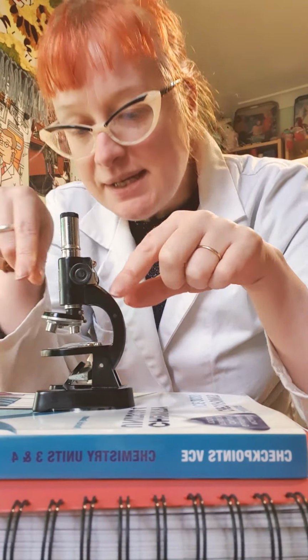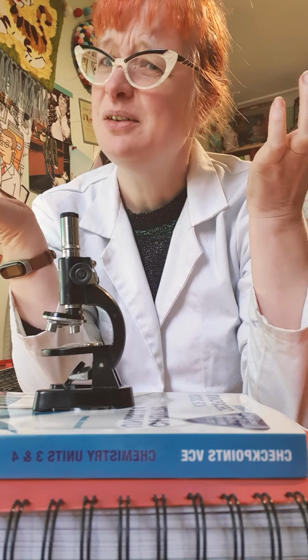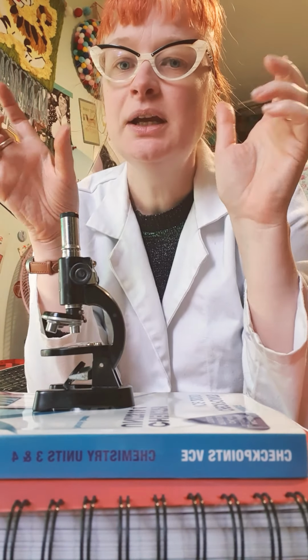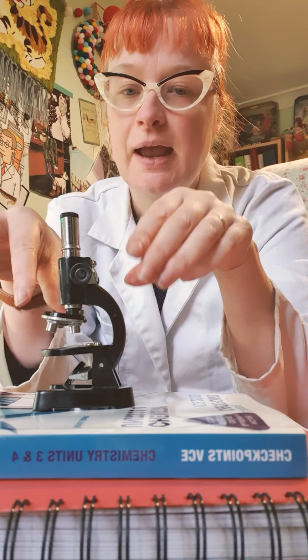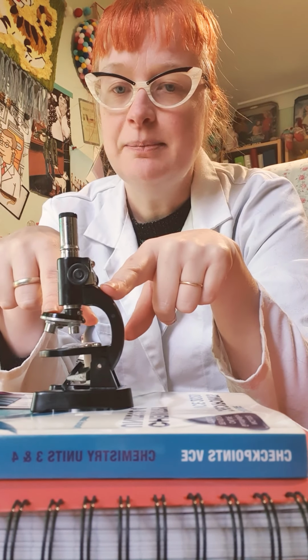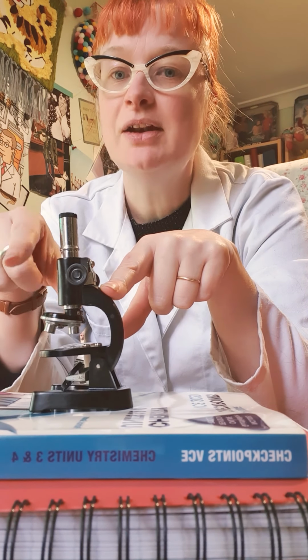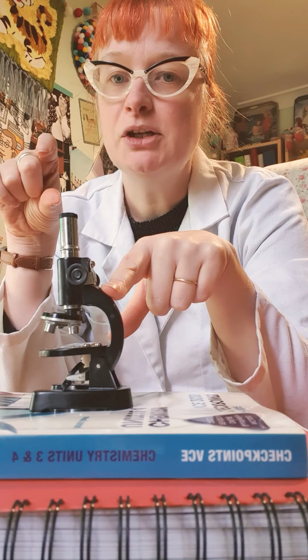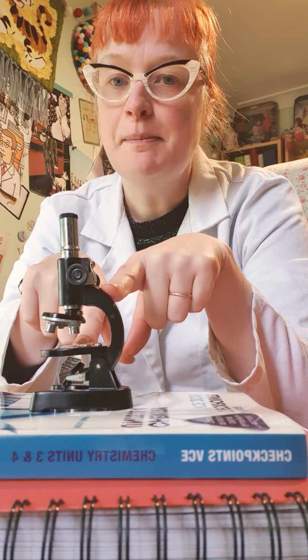But you've tweaked it, you've gone, right, I can see my flea or my hair or my cell. I can see something, but it's not very much detail. So you've gone, I've got something there, I've got enough light, it's all working, and then you can turn this bit here. So you can turn it round. I can't, but you'll be able to turn it round, and then you'll be able to look and see it much closer. You'll be able to see your object magnified much more.